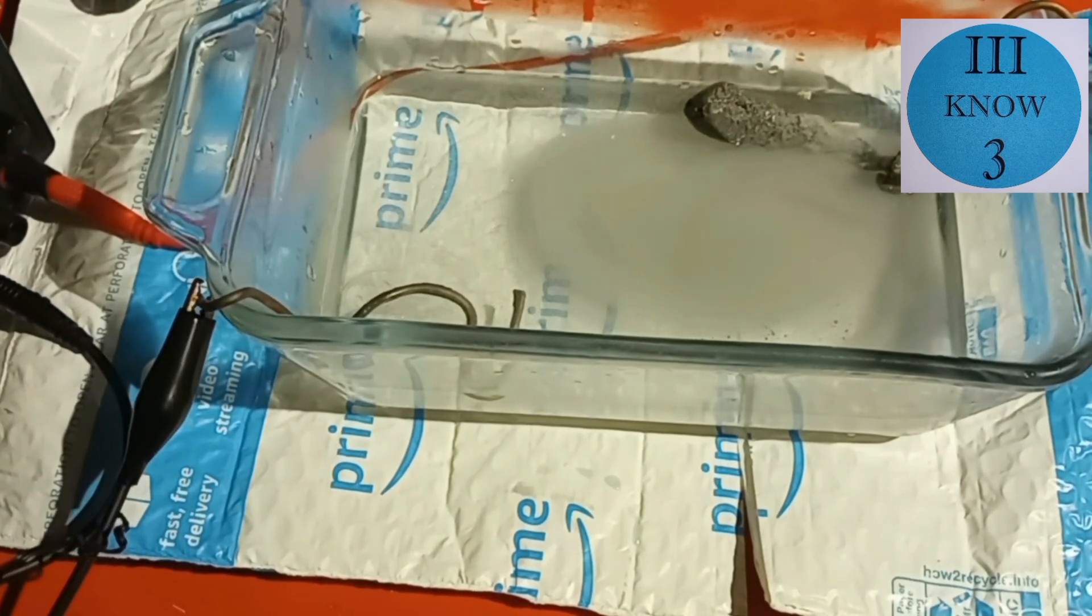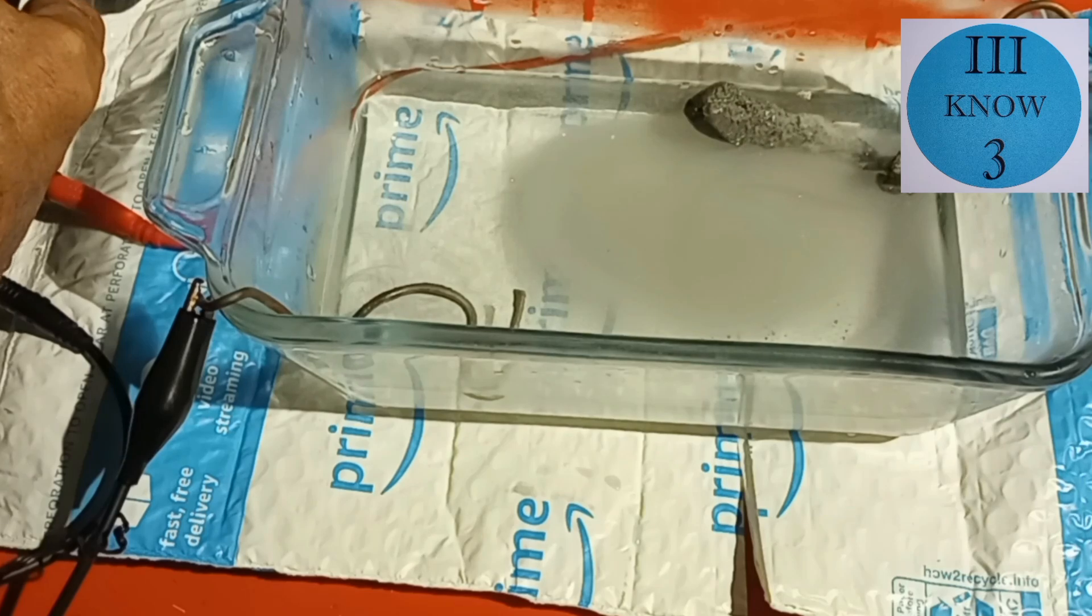So now that we have this all set up with more pure materials, hopefully we'll get better results than the last one.